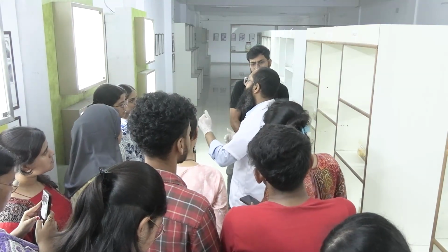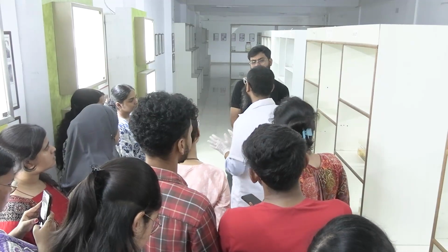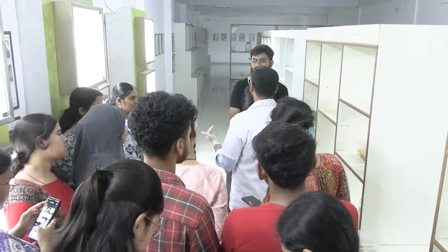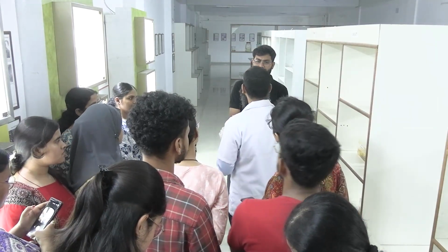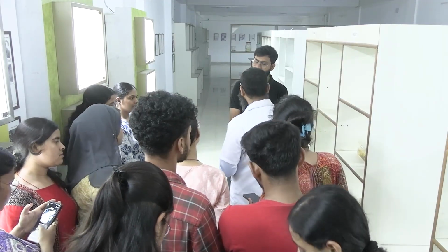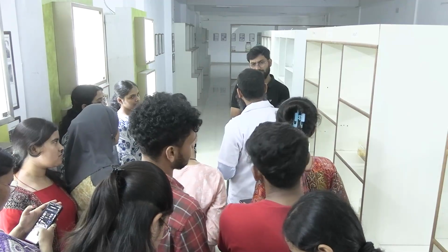But if it is more than half an hour, then it is okay, but it should not be more than 1 hour. ঠিক আছে, it should be within half an hour, but if it becomes more than 1 ঘন্টা, তার মানে ডেফিনিট চেঞ্জেস গুলো আসবে, মাইক্রোস্কোপি করতে অসুবিধা হবে। ঠিক আছে, then it is kept in the formalin and immediately sent to the lab.